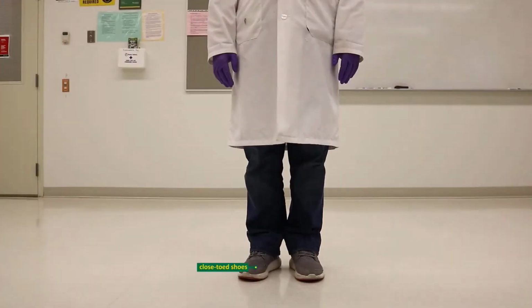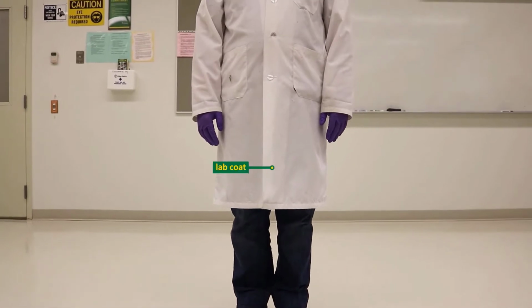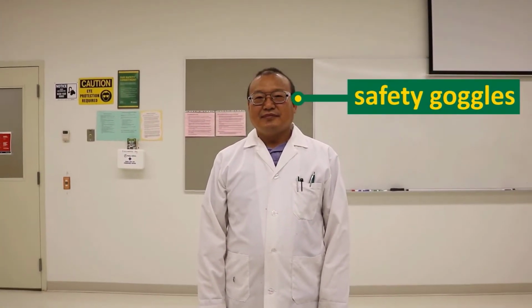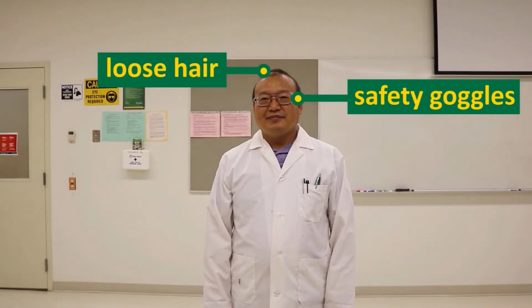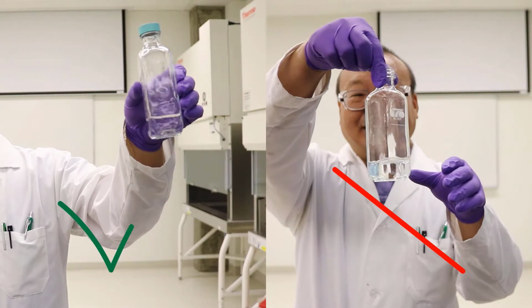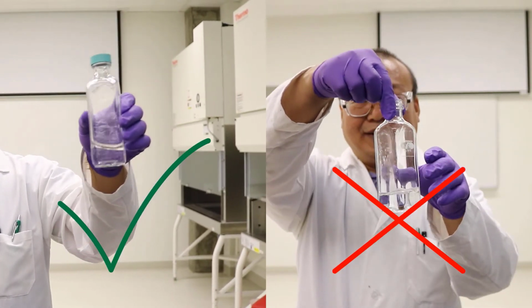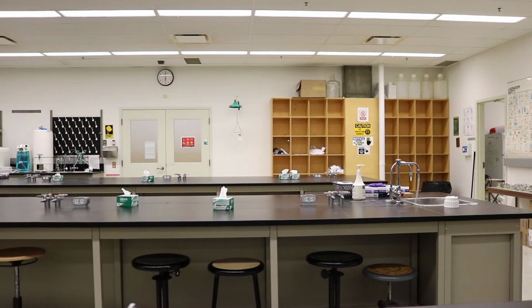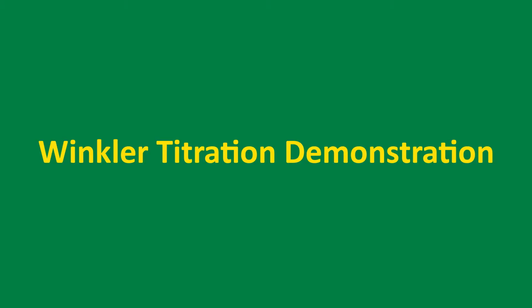Please wear all required PPE. This includes safety goggles, a lab coat, gloves, and tie back long hair. Note that glass bottles can cut fingers, so always hold them in the middle. Be careful of water on the floor in this lab. Walk slowly. In the Winkler titration method, the oxygen concentration is determined through a series of chemical reactions.